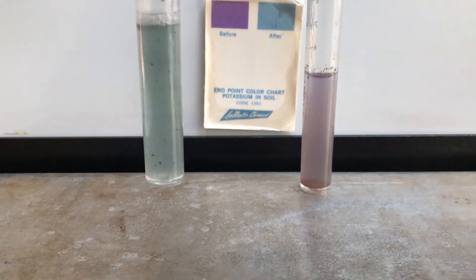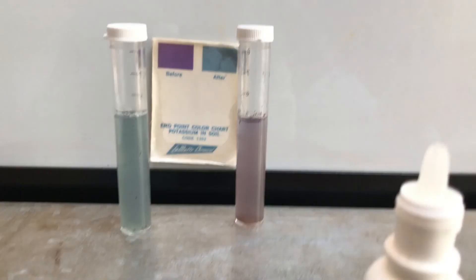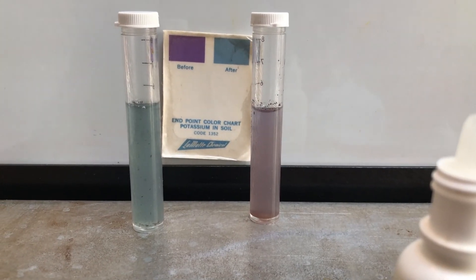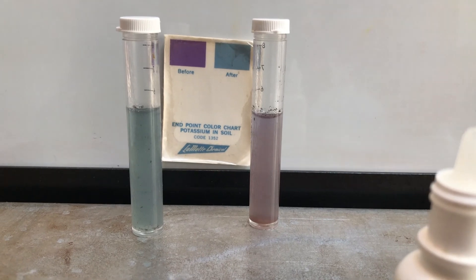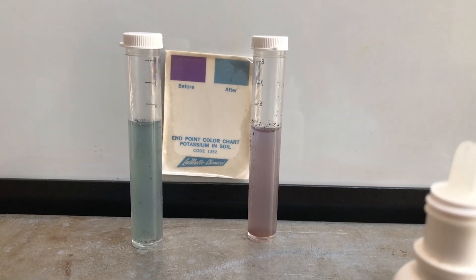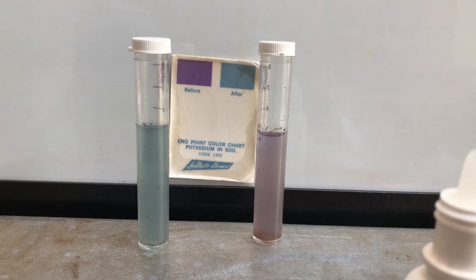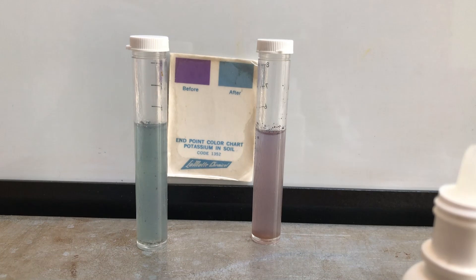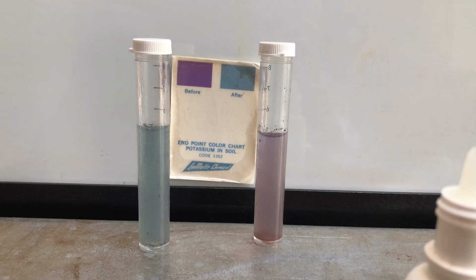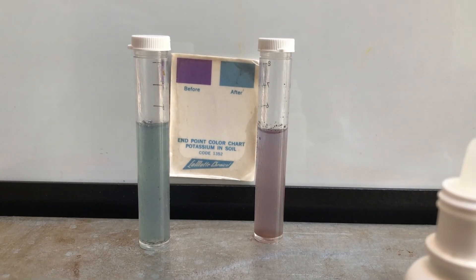And what do we see? It has turned completely blue as compared to our other one, which is still purple. So we know that took 9 drops — we have a high level of potassium in our crime scene soil sample. Now we're going to do the same thing for our suspect sample and we will take a picture of the results.